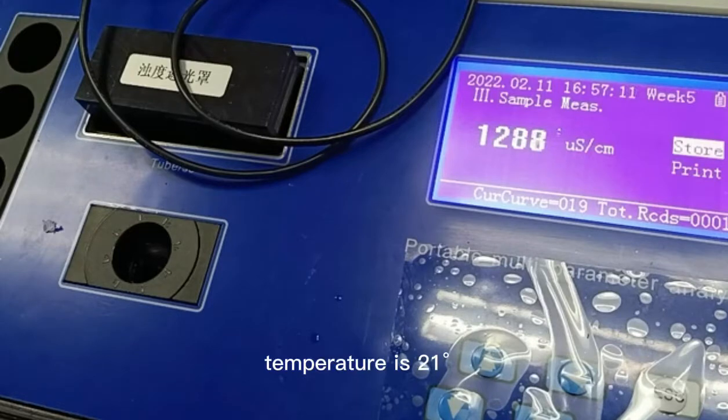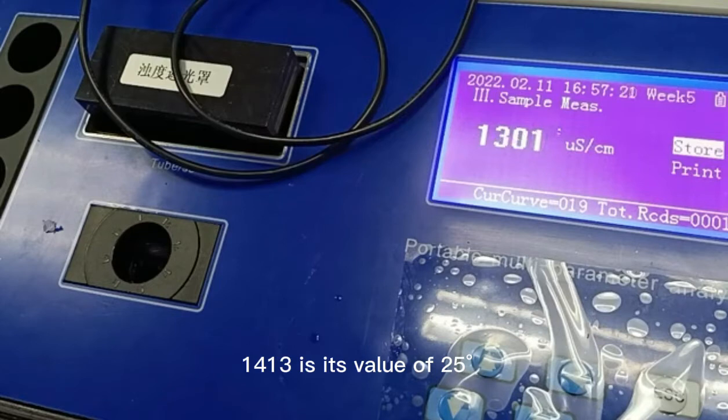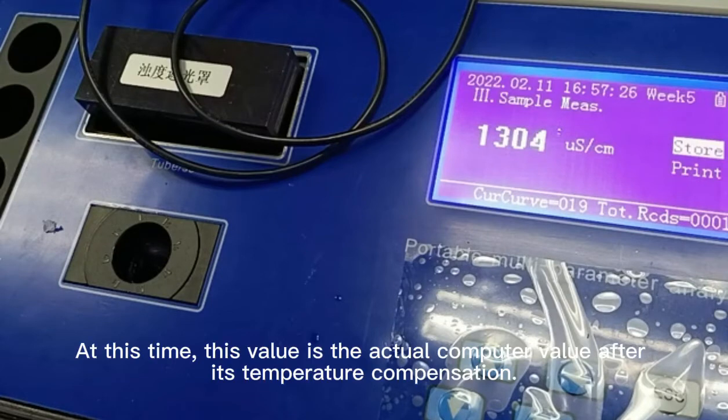Temperature is 21 degrees. 1413 is its value at 25 degrees. At this time, this value is the actual computed value after its temperature compensation.